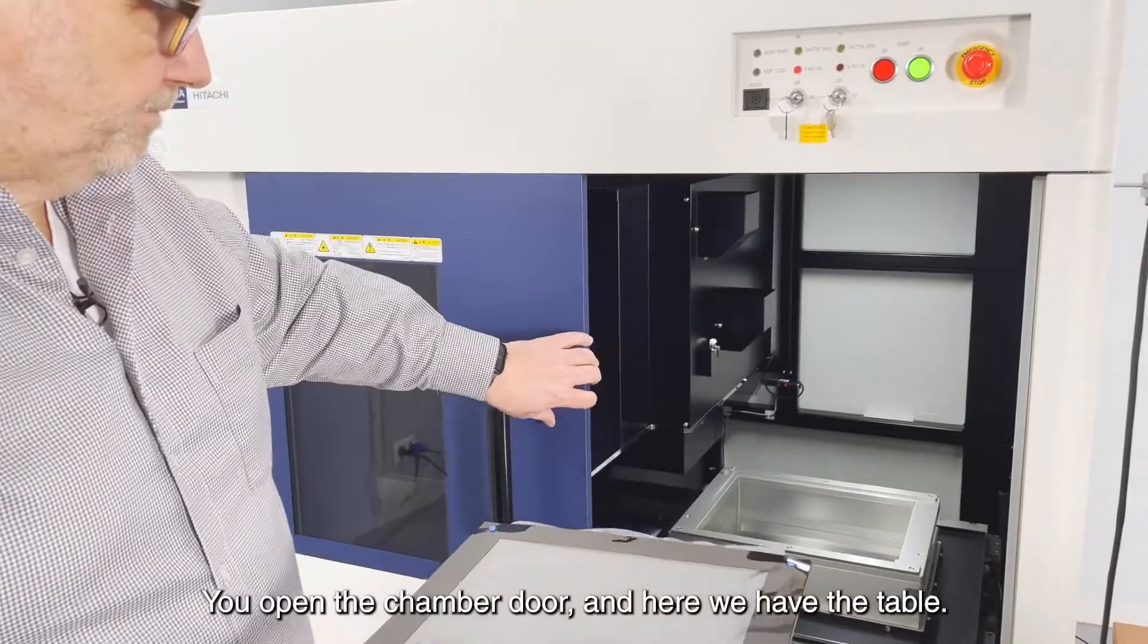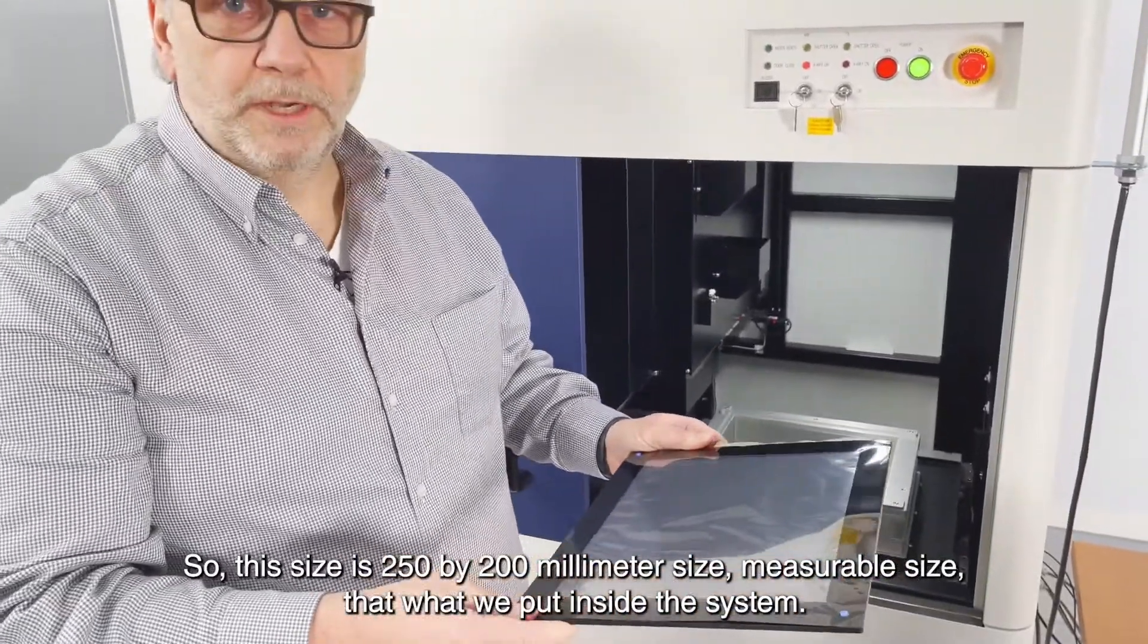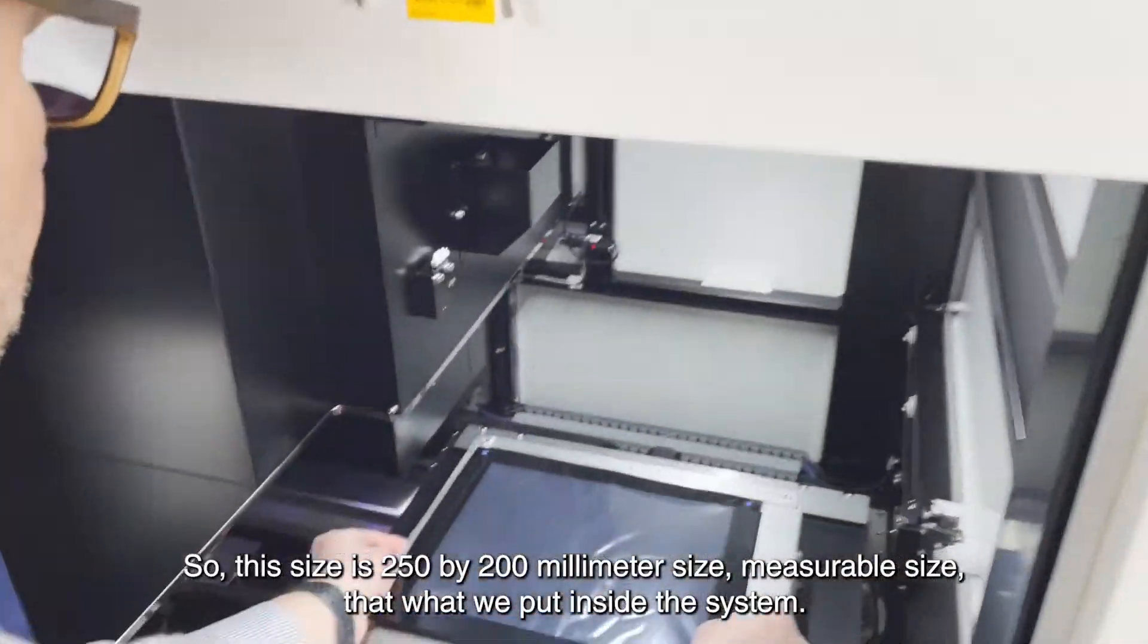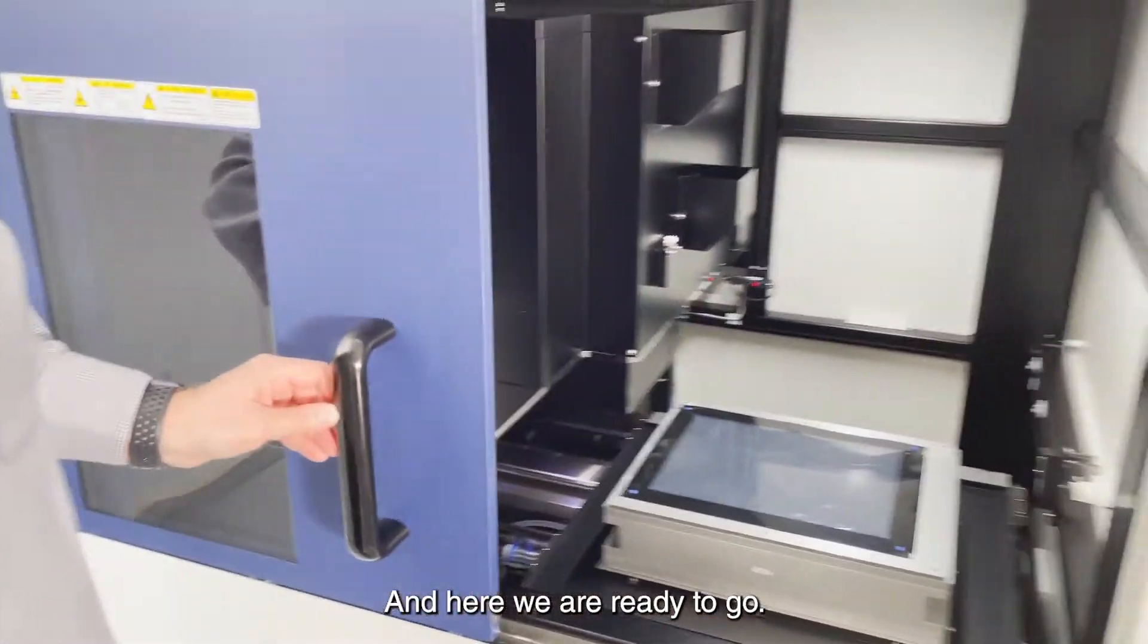We open the chamber door and here we have the table. So this size is 250 by 200 millimeter size, measurable size. That's what we put inside the system. And here we are ready to go.